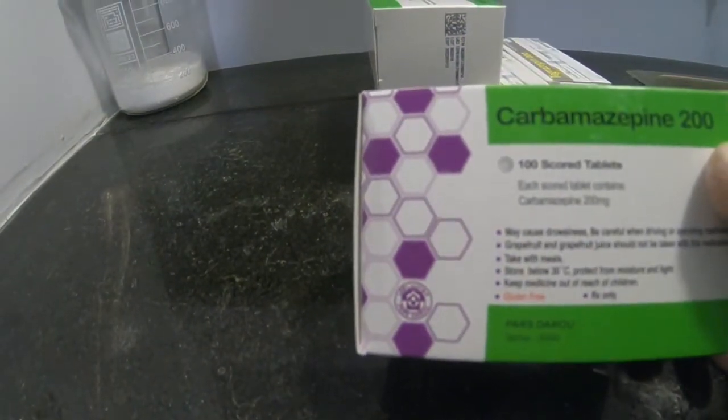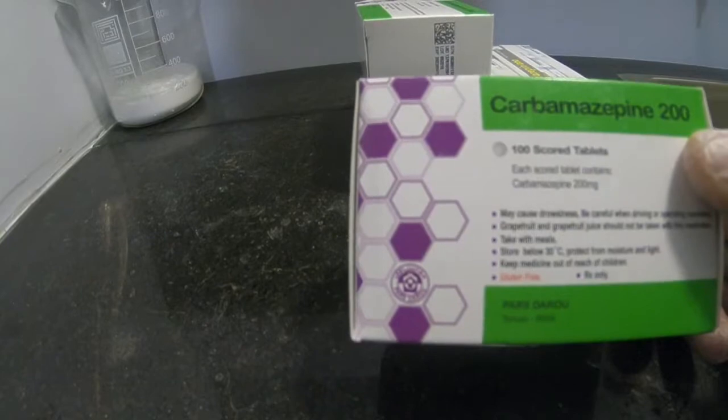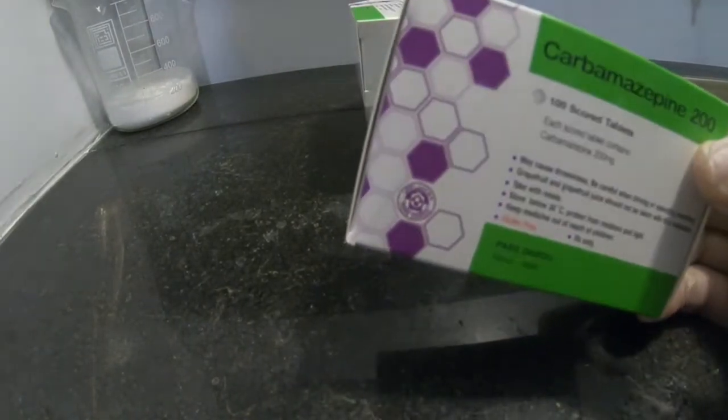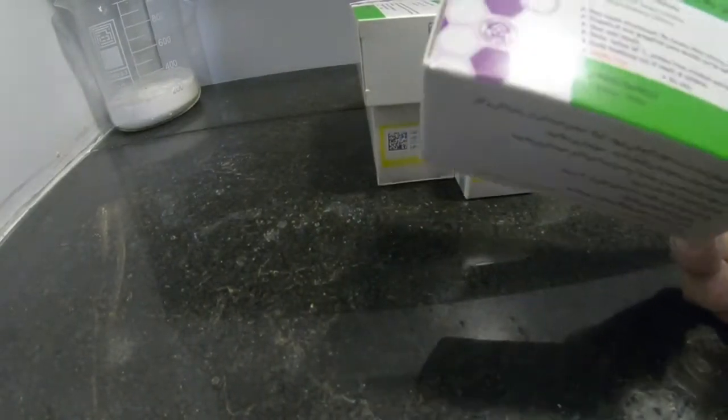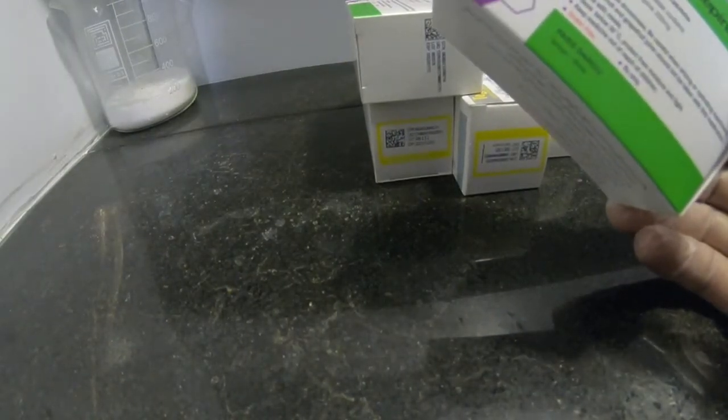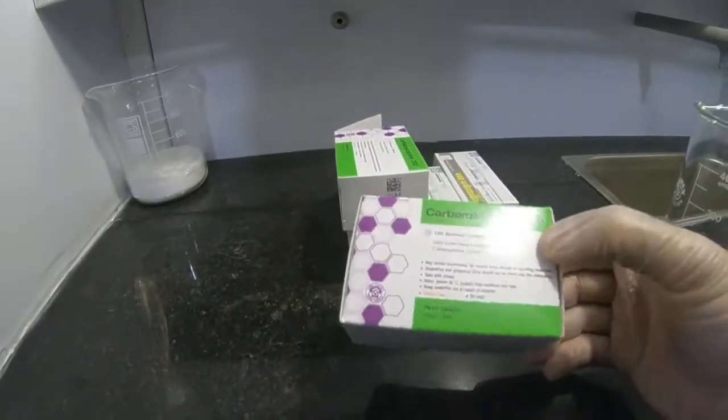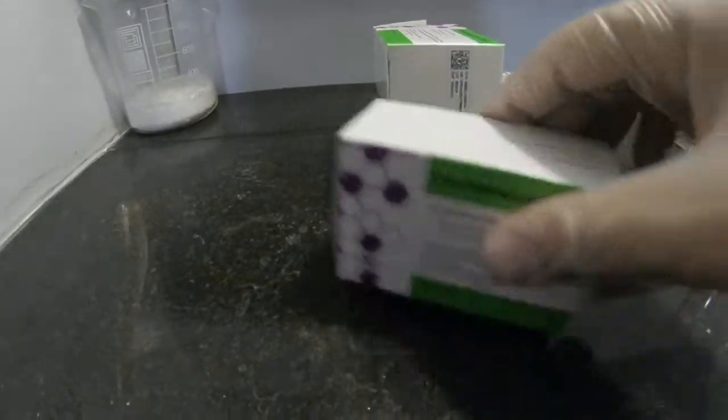Hello guys, today I'm going to extract carbamazepine from its pills. I need it for some research, so I bought this from the drugstore.